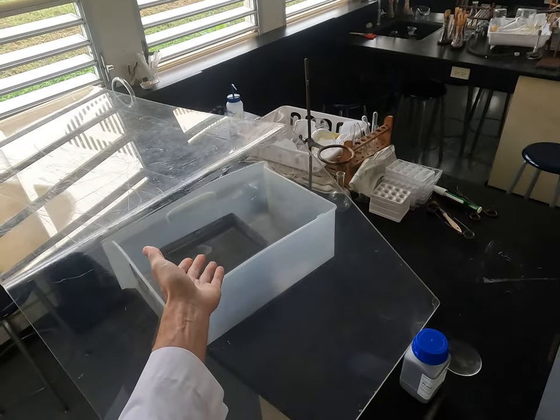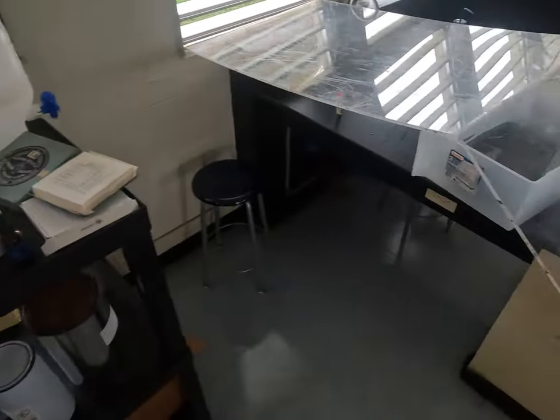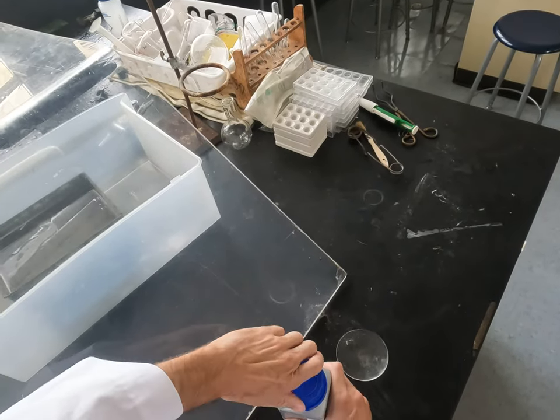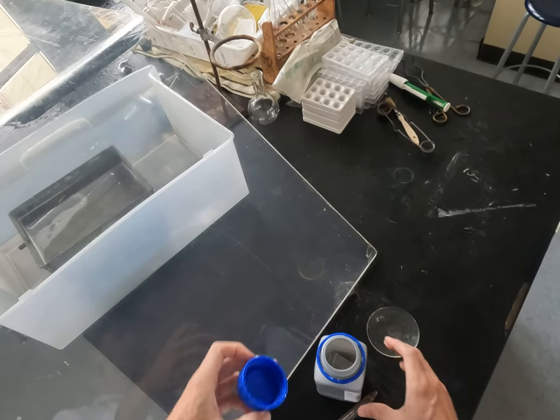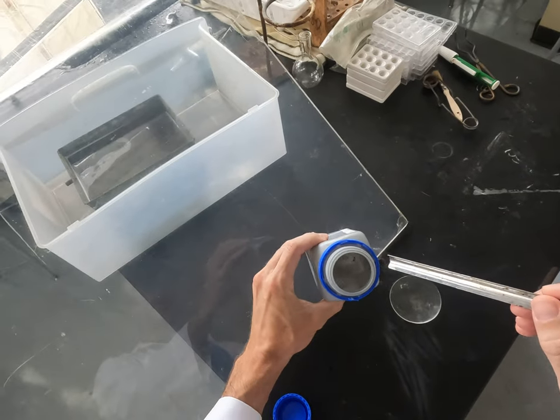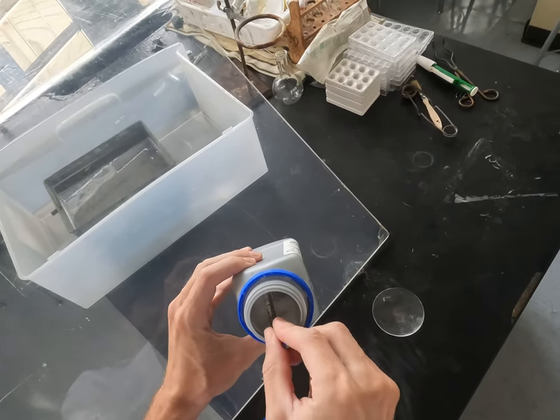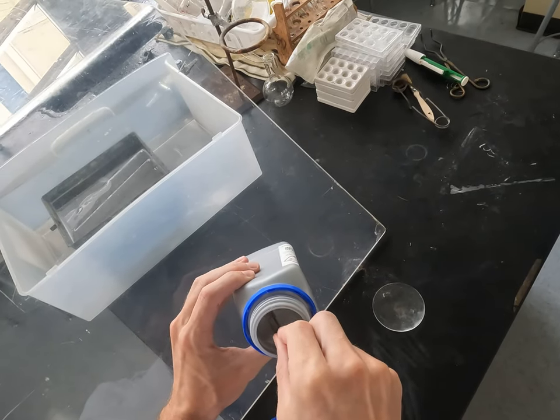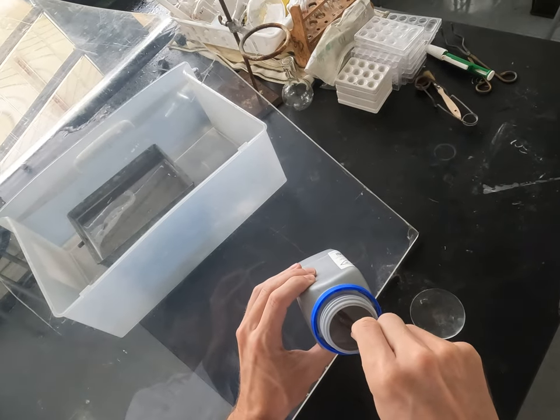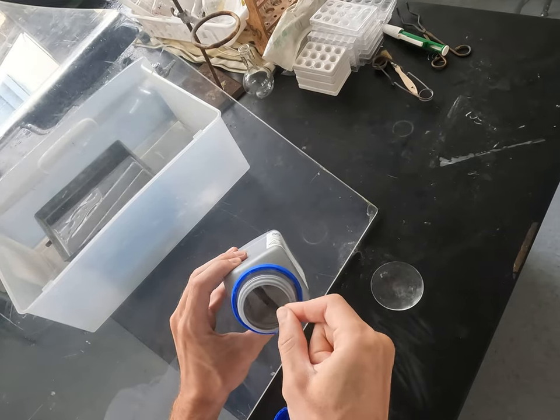I have here a bucket of water. And what this looks like — what would you expect to see with potassium? Do you have any idea what its general appearance would be? It's a metal.